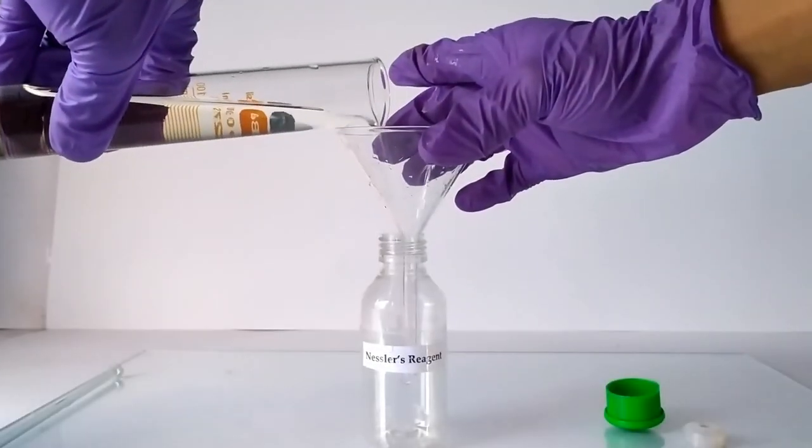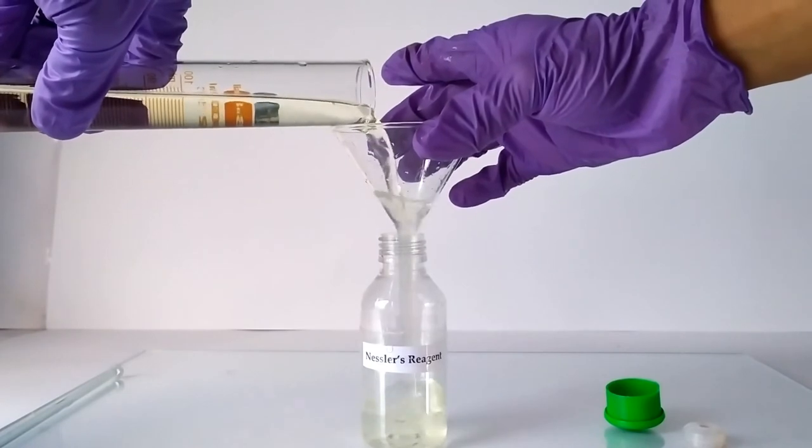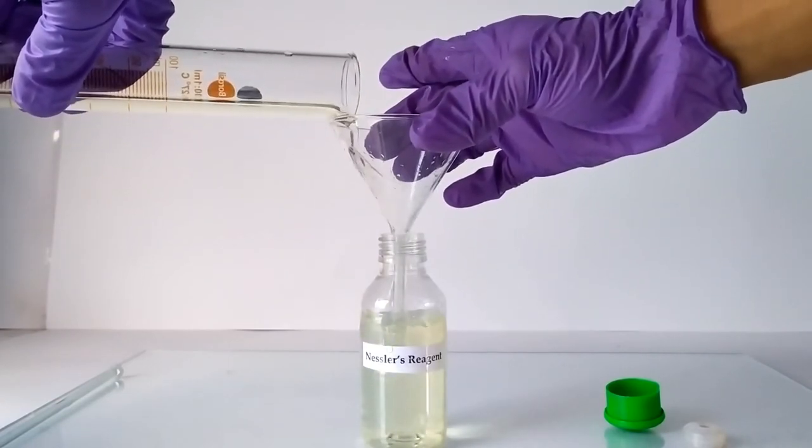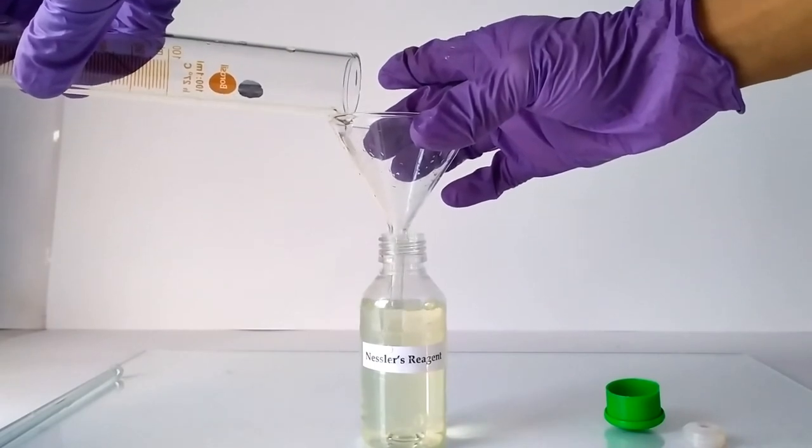Transfer the prepared reagent into the appropriate labeled container for final storage. Cap it tight and store it in a cool place away from direct light.